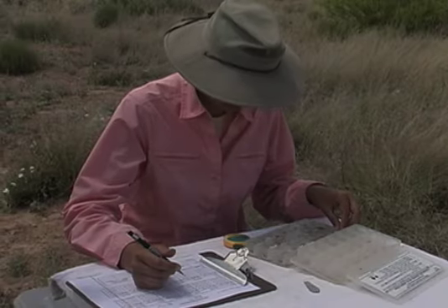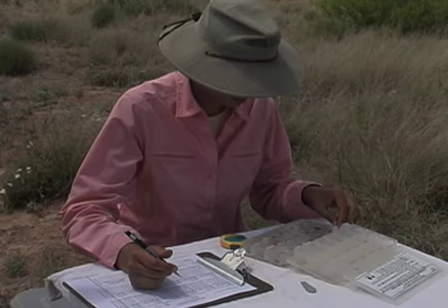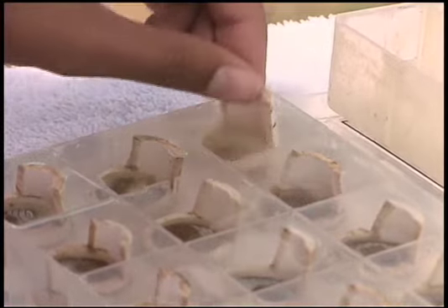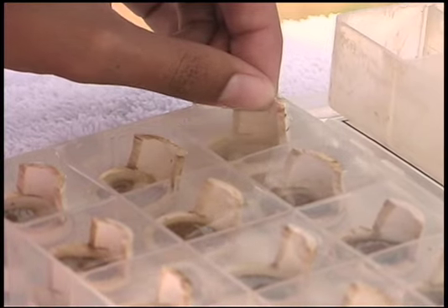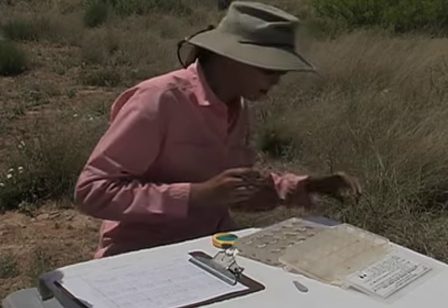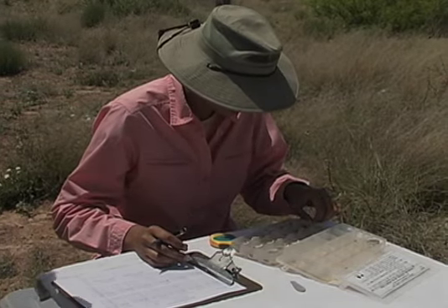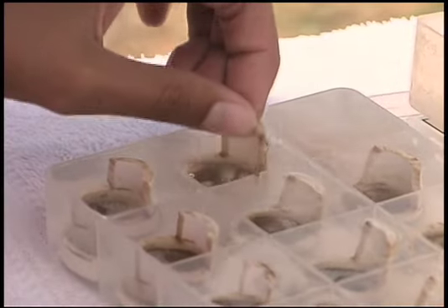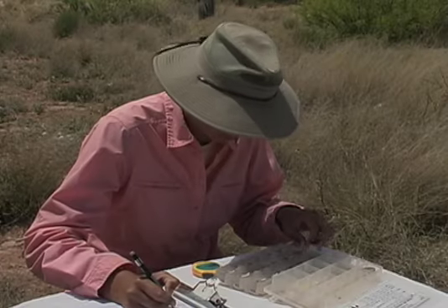After 5 minutes of soaking, raise the sieve completely out of the water and then lower it to the bottom without touching the bottom of the tray. And rate the sample when it is still under the water. It should take 1 second for each sieve to clear the water's surface and 1 second to return to near the bottom of the box.